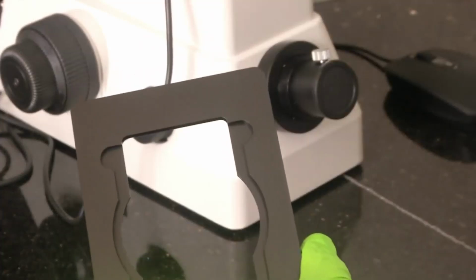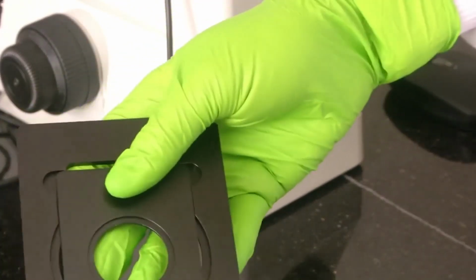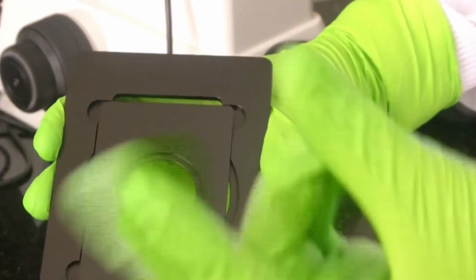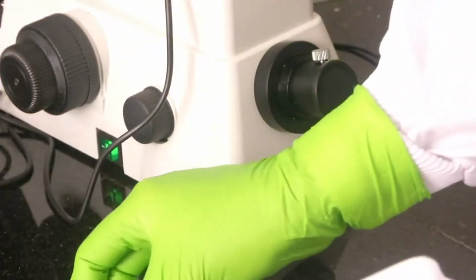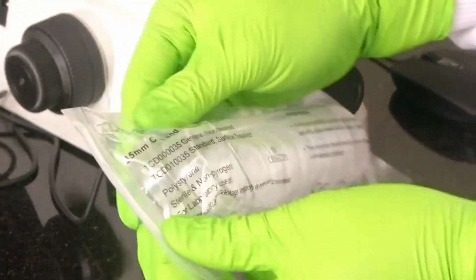Now there is an add-on to this where you can add a small addition to this. You add it like this, then it will become smaller, and you can add what is called a 35 mm tissue culture dish on this. Let me just show you a 35 mm tissue culture dish. A packet of 35 mm tissue culture dishes.